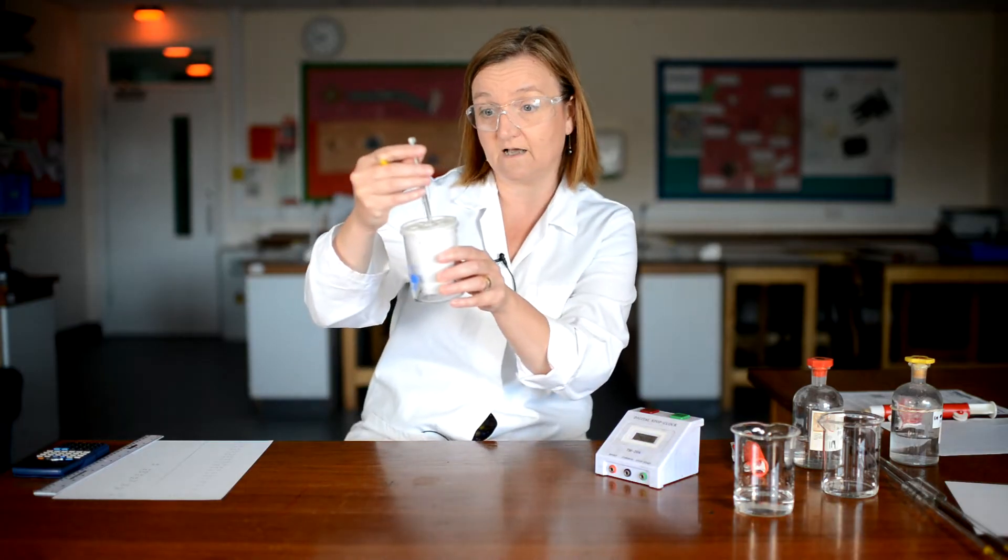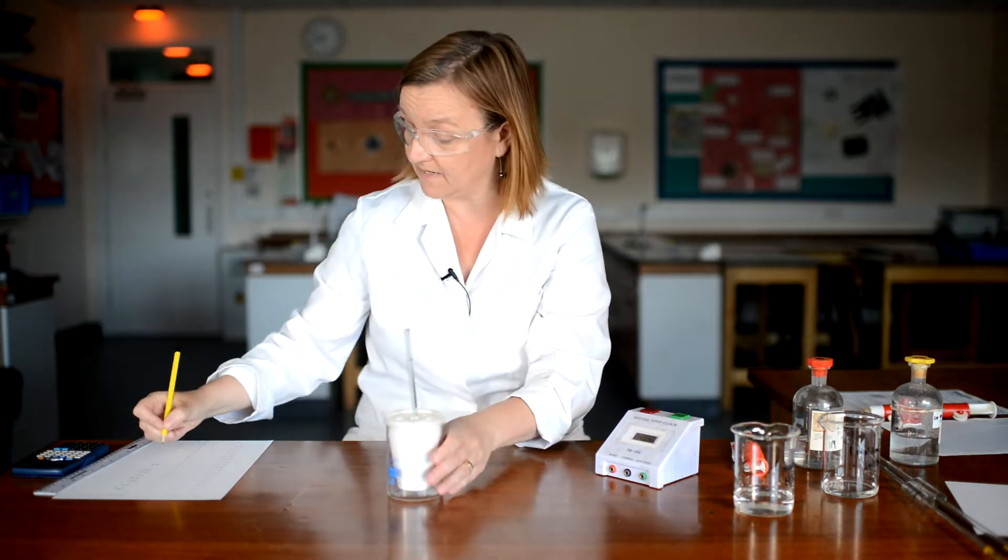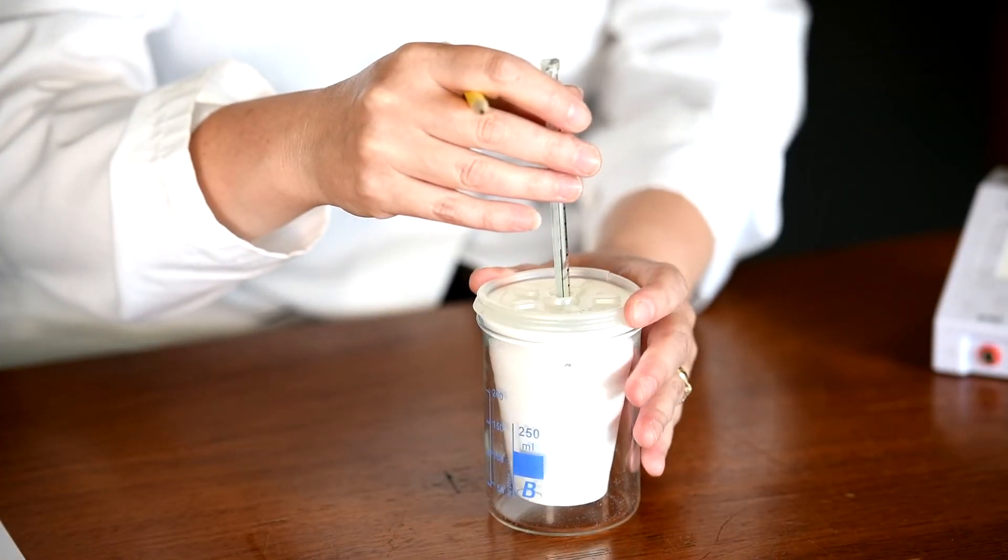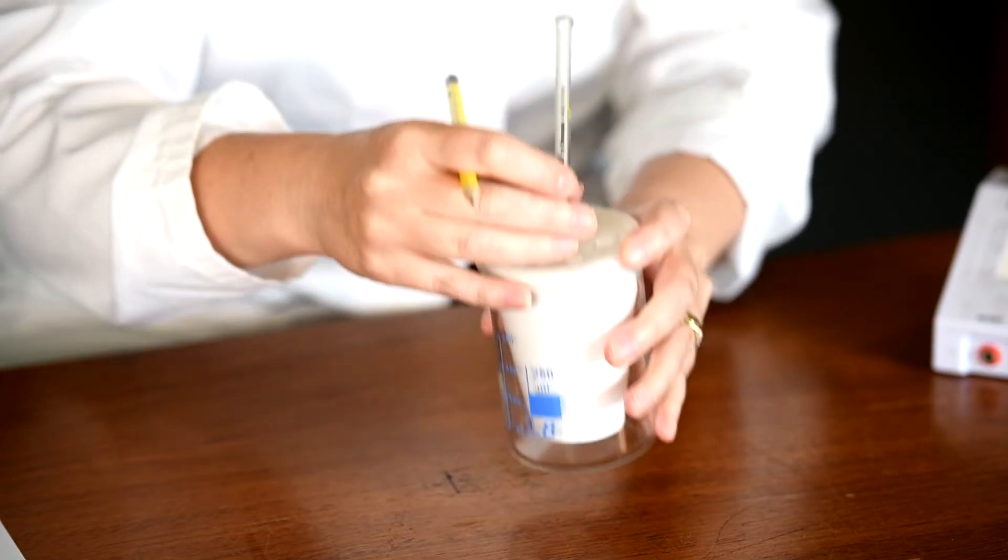At four minutes, I am now on 33. And I'm going to continue to take these temperature readings every 30 seconds until the temperature starts to drop back down, showing me the reaction has gone to completion, all the energy has been released. And now it's starting to cool down as the energy is released to the surroundings. So four and a half minutes just coming up. 34 degrees.